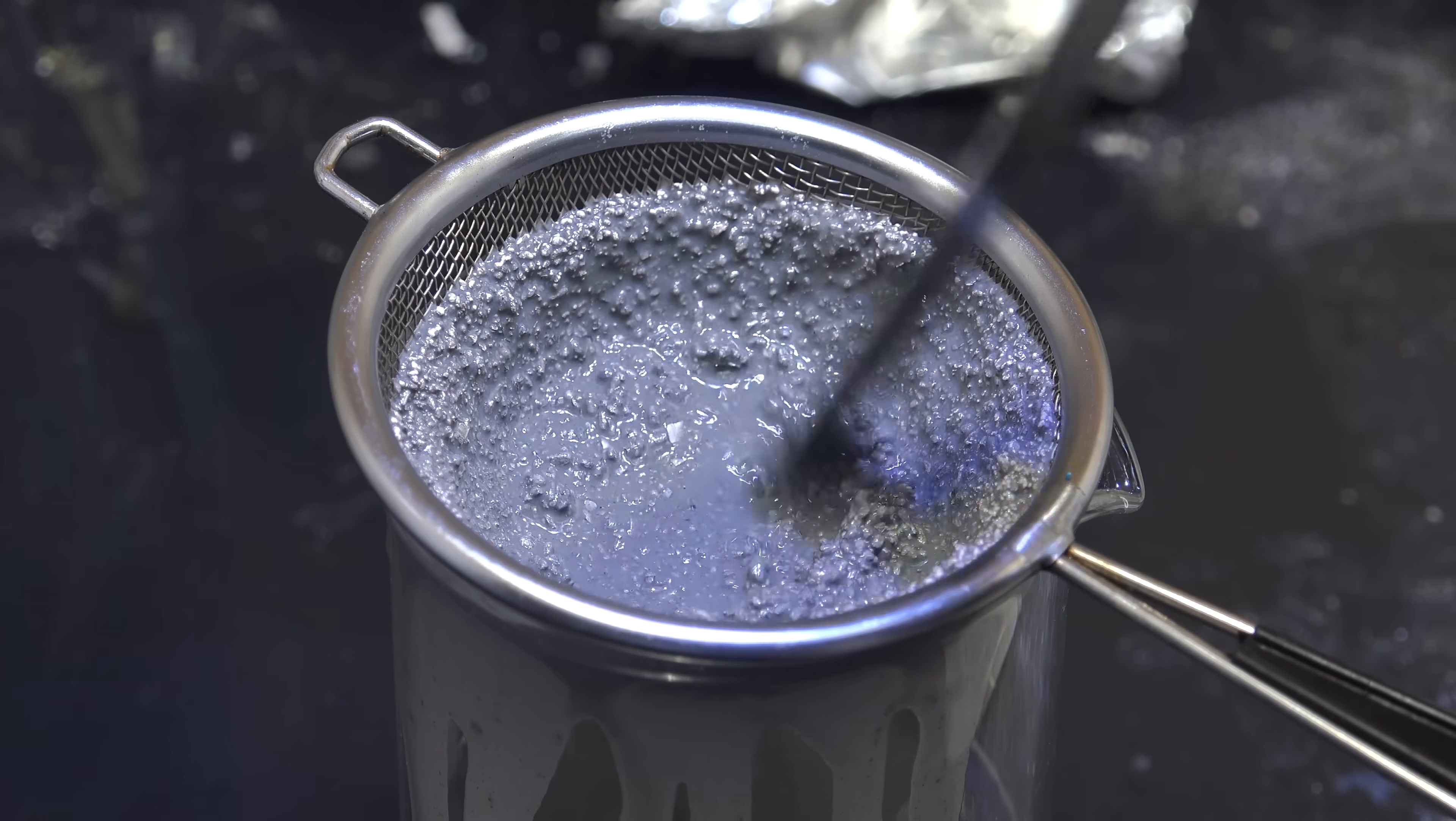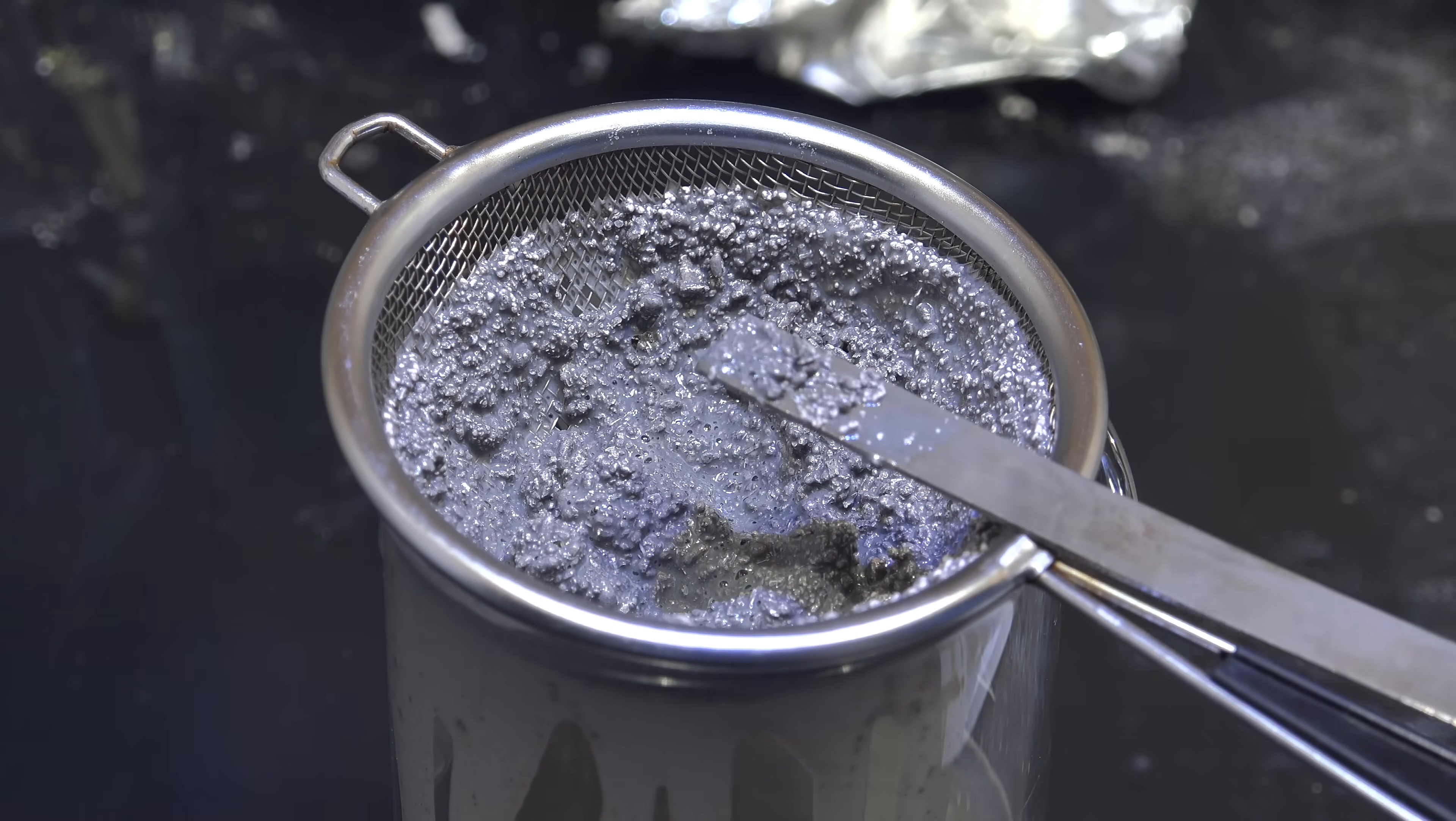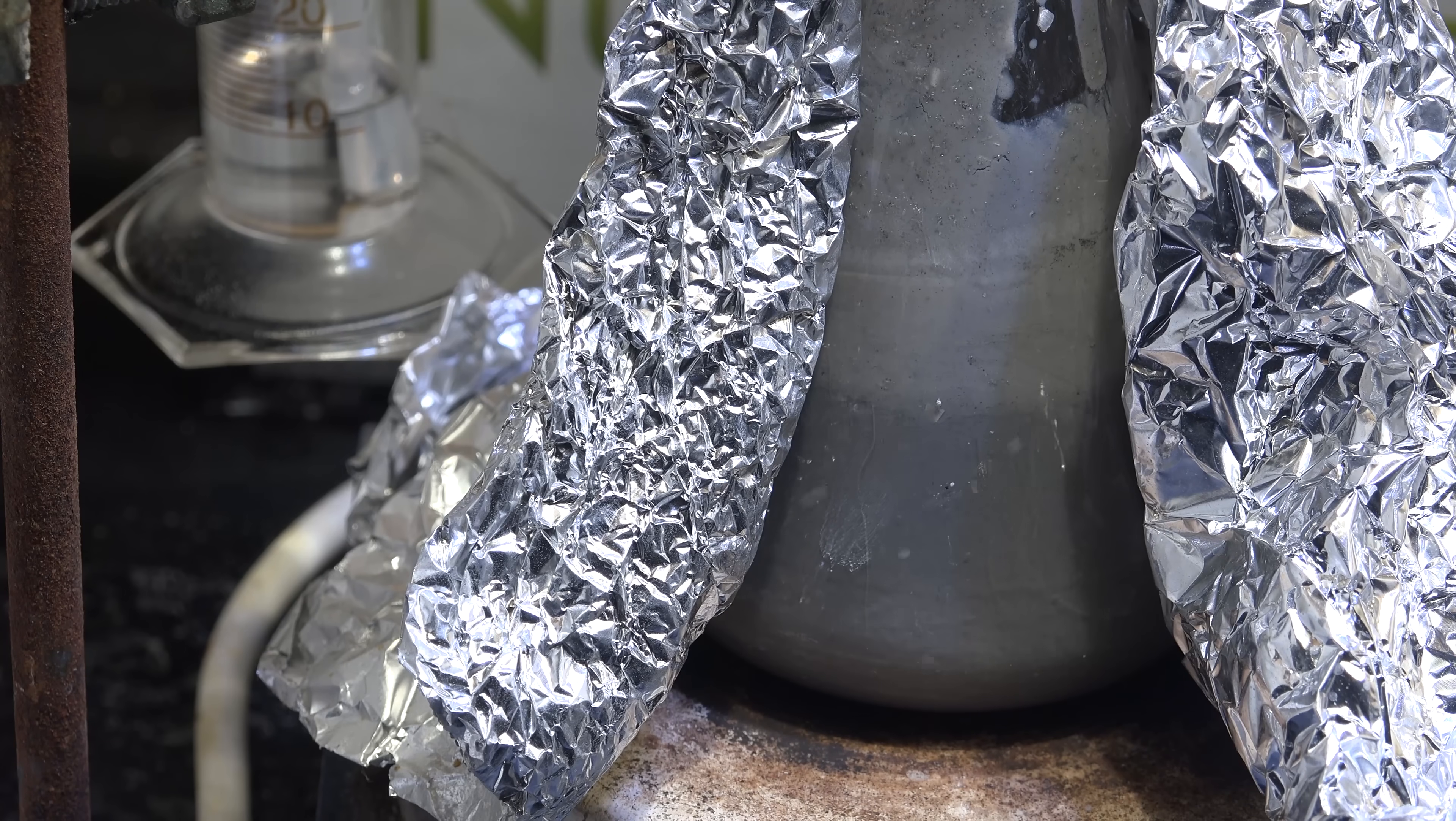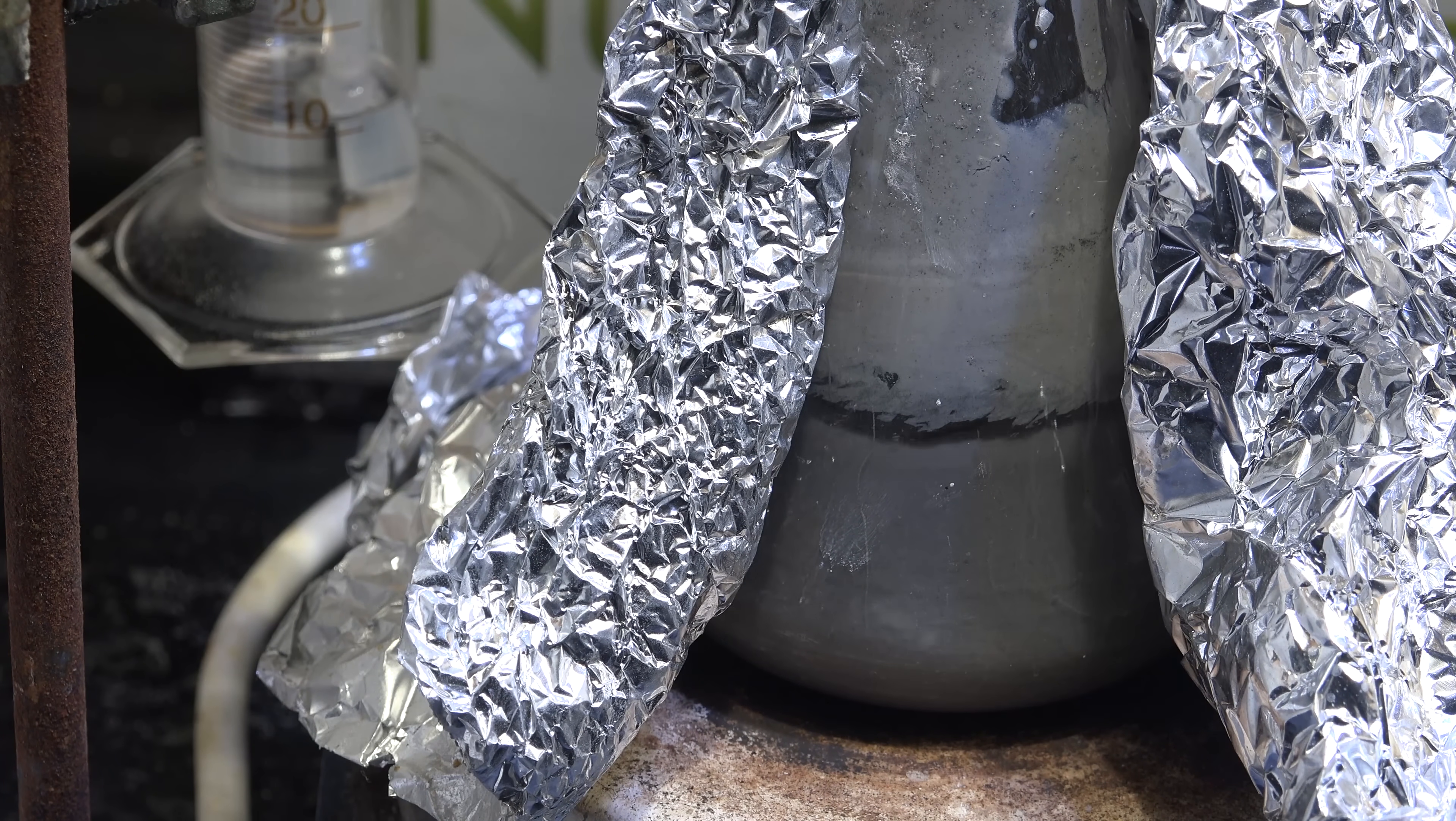Straining out the sodium, I see another problem. The sodium is in tiny spheres and not large globules. This is not good since I'm sure a lot of them pass through the sieve. To confirm the alcohol had decomposed, I poured the entire reaction mixture back into the reaction flask along with about 5g of extra magnesium and another 1 mL of tea tree oil. The reaction did not continue and in fact started to backflow indicating total reaction failure.